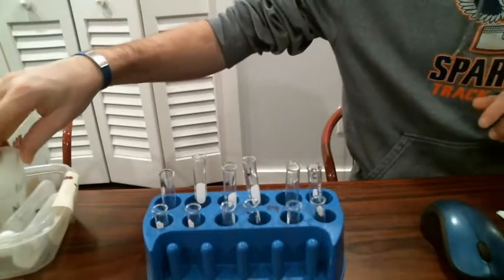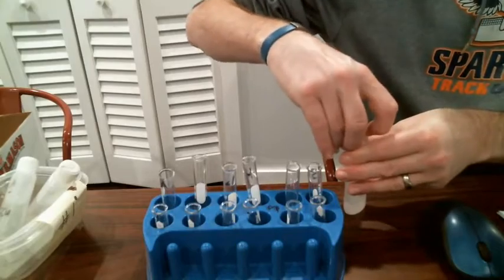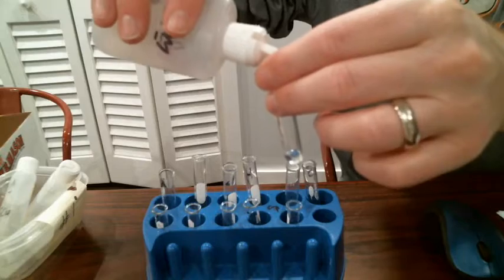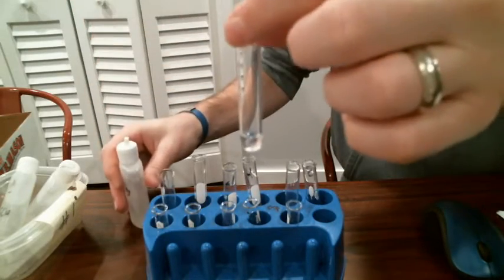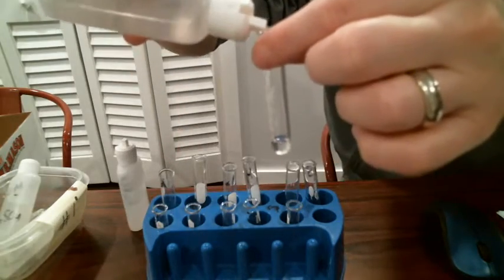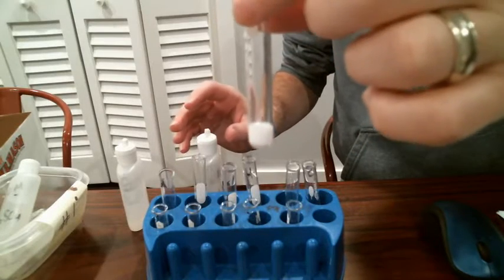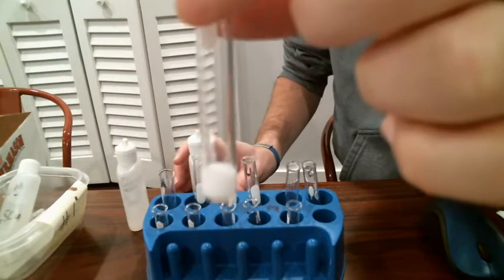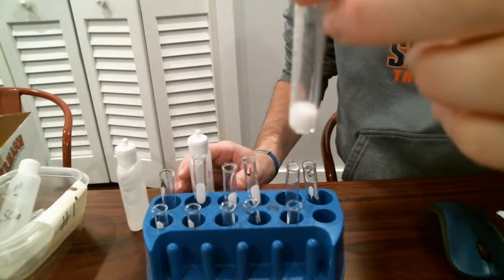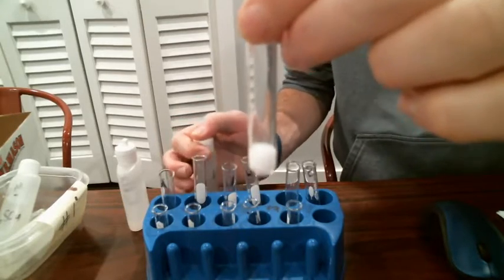So, starting with reaction number one, we have barium chloride with sodium sulfate. So I add in some drops of my barium chloride, and I'm going to add some drops of my sodium sulfate. And there we go. I'll notice that color change. And it might be kind of hard to see on the camera, but over time, you will notice that that white solid settles to the bottom. So we actually have a precipitate formed in this reaction.